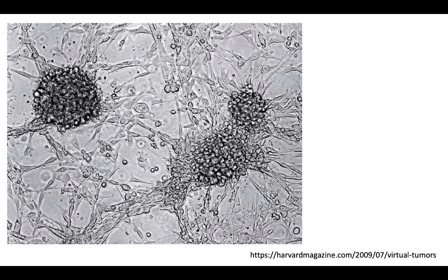Okay, let's get started. As you can see, I want to start off with a small presentation just to give those viewers who do not know what a flow cytometer is and what the technique means or what the actual use of the technique is. This video can also be watched by experts who know what a flow cytometer is and who just want to get started on using FLOWJO as a software for data analysis.